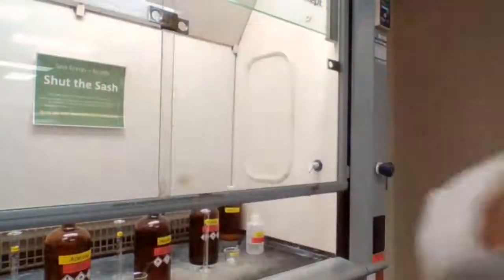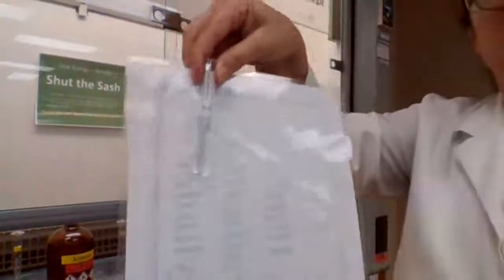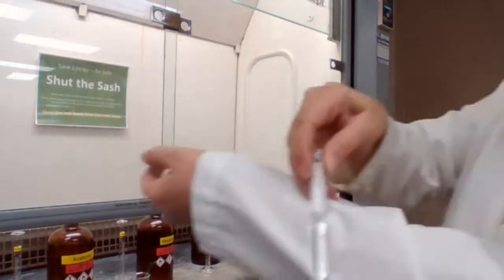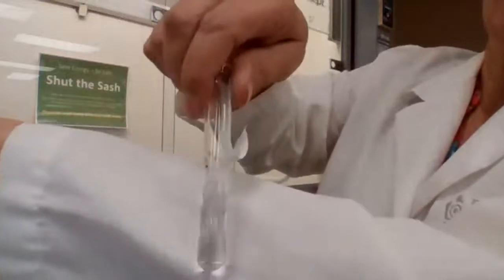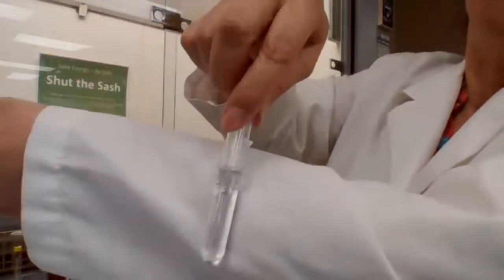See if the white background works better or the black one. Which one helps? None? See, there's a line right here. And if you mix it, it's not going to mix and the line doesn't go away. So you have 2 layers there.